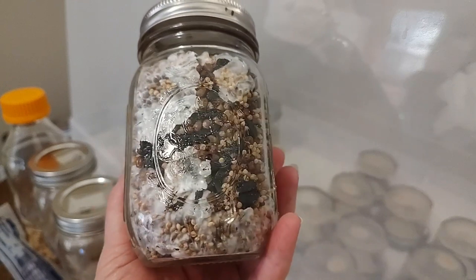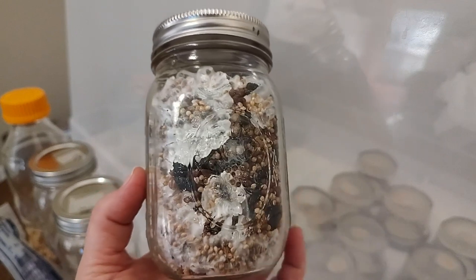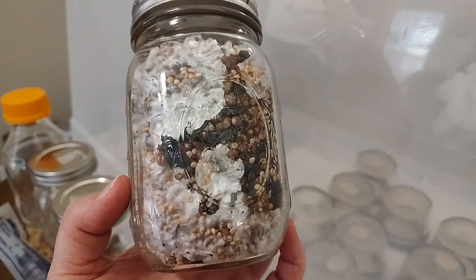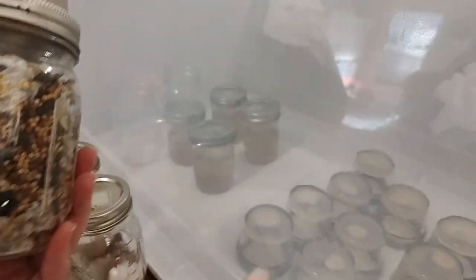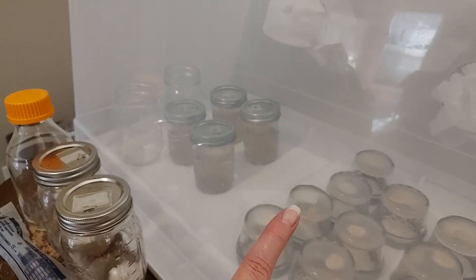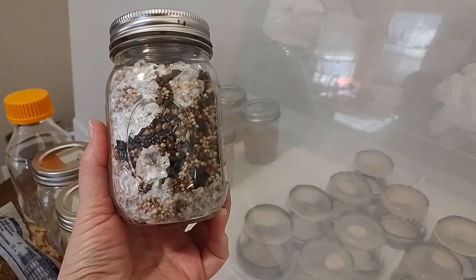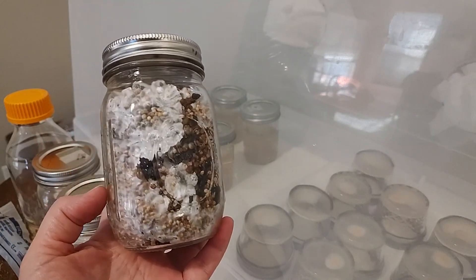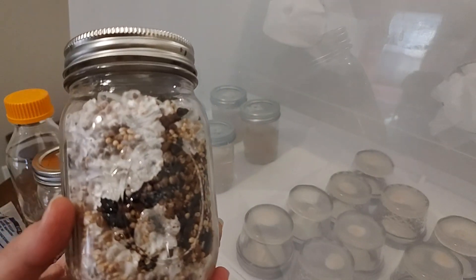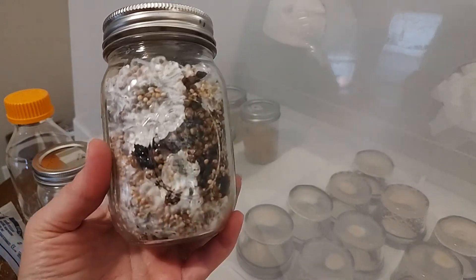It's a little bit slower growth for your spores in the water agar, or you can do an incredibly light MEA. That way you give your spores the opportunity to grow out on the agar plates, and then you can transfer those, eliminating contamination. Every time you do a transfer to a new plate, you're eliminating contamination. Once you have plates that have a rhizomorphic growth — the antlers, the branches, very white and thick — you can put those to your grain.